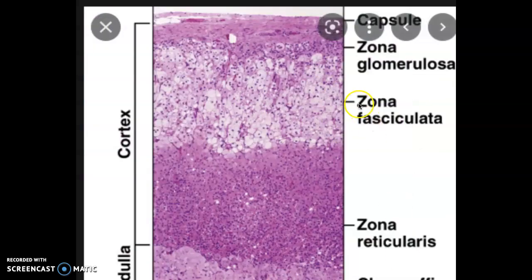So I actually really like this one, a nice clear fasciculata. I know the reticularis is there, then the glomerulosa is there, and then the medulla must be what's there. I also like counting the zones. So we have the capsule, we have this glomerulosa, the fasciculata, and the reticularis.